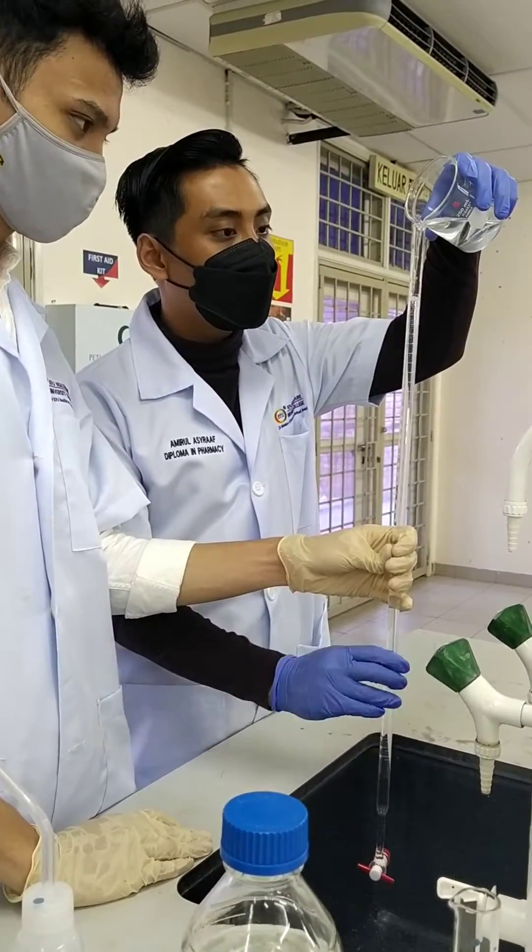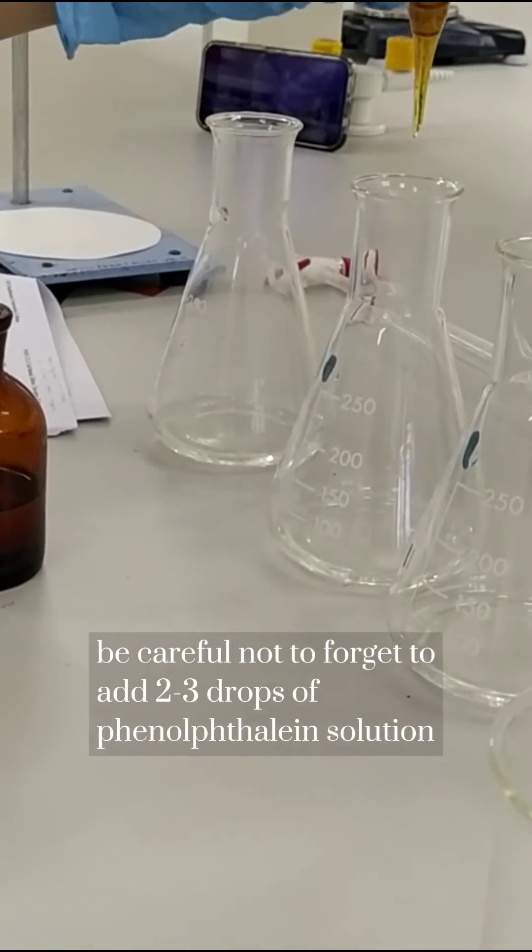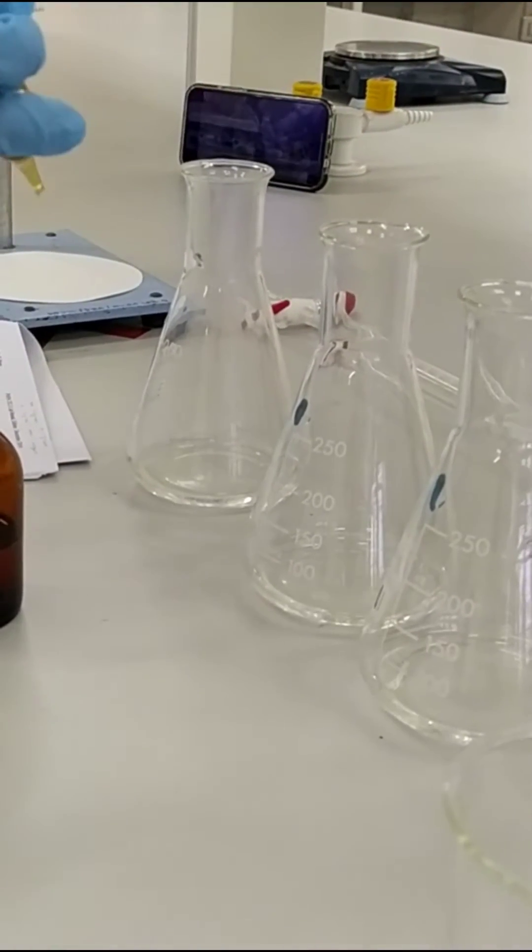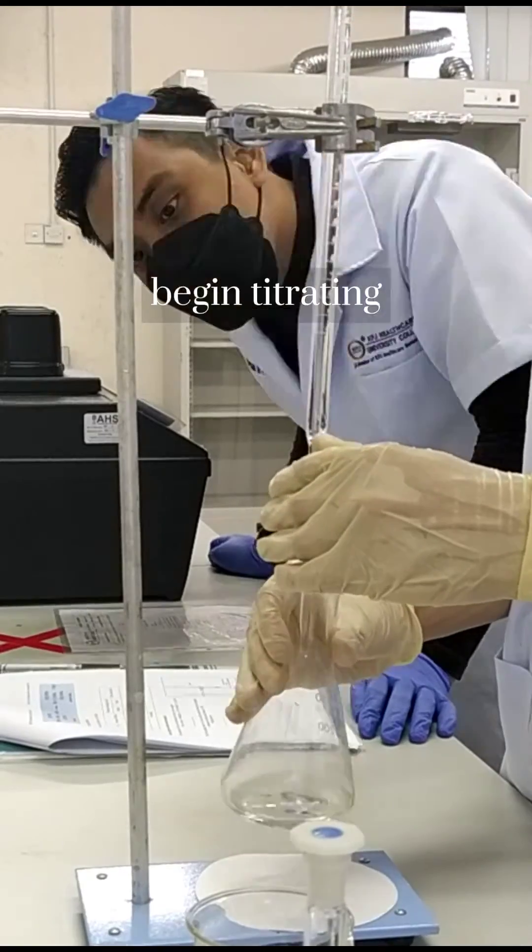Prepare your burette with your sodium hydroxide standard solution, one molar, and put in a few drops of phenolphthalein indicator solution.